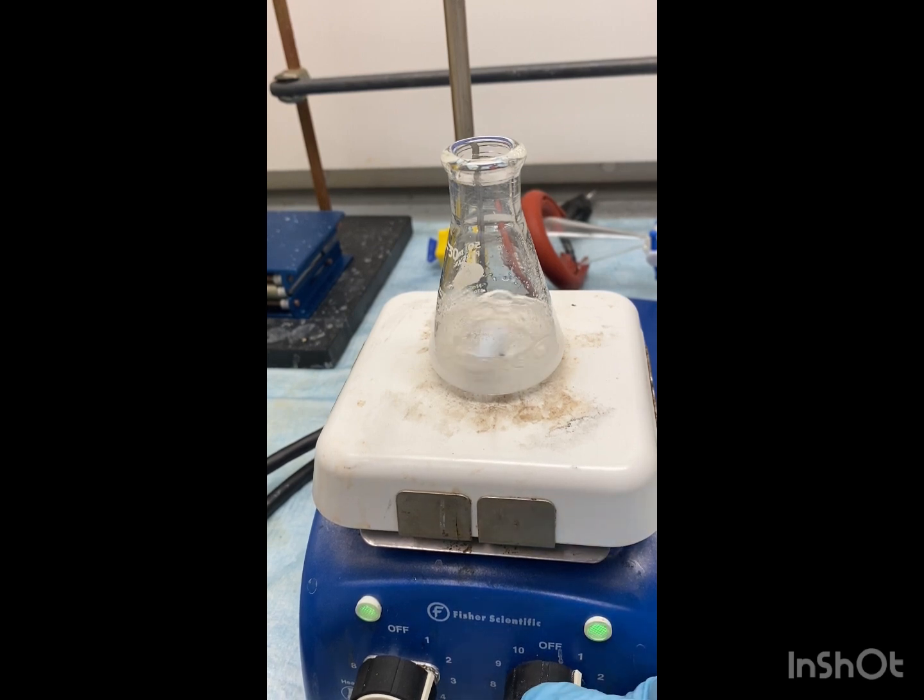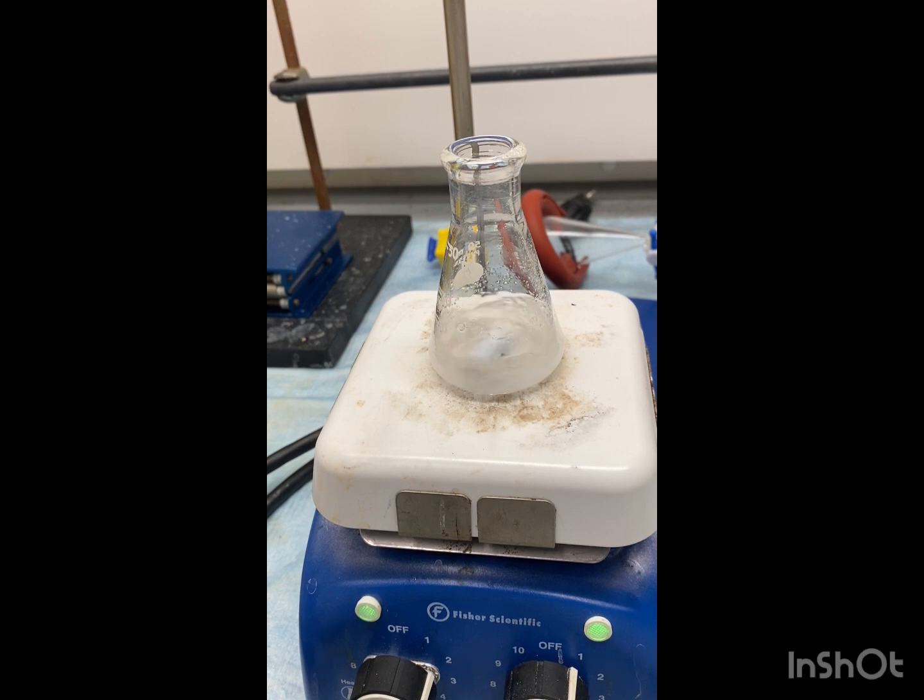And we want around half a gram. So once all this is heating and dissolving, we'll go ahead and get that ready.